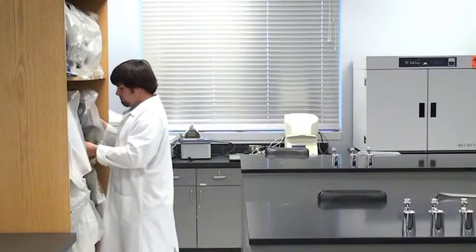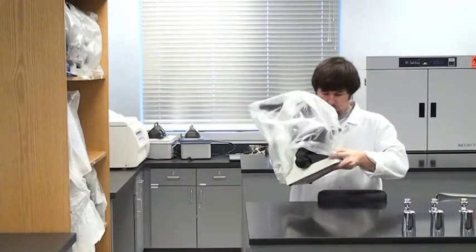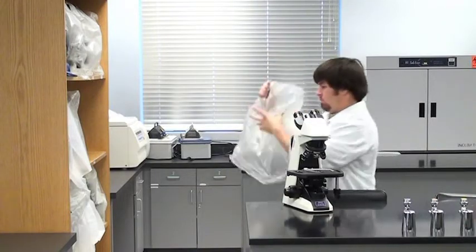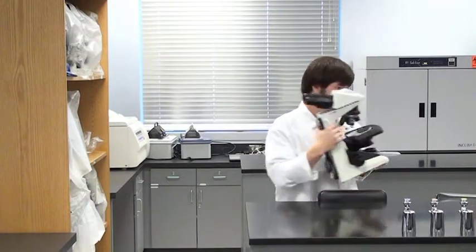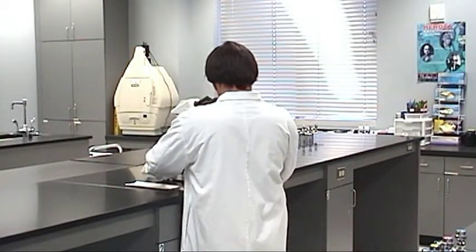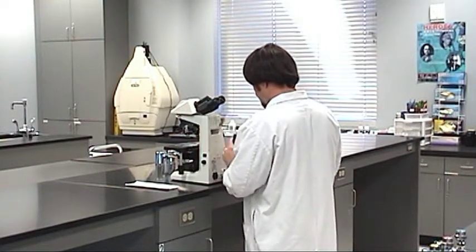Remove the microscope from its storage location. If it has a dust cover, remove the cover and store it until you are done with your lab work. When you carry the microscope, hold the microscope arm with one hand and support the base with the other. Although it looks rugged, the microscope is a high precision instrument that can be damaged if not handled with care.